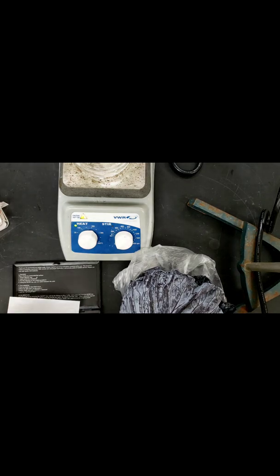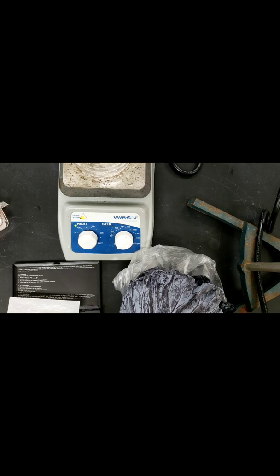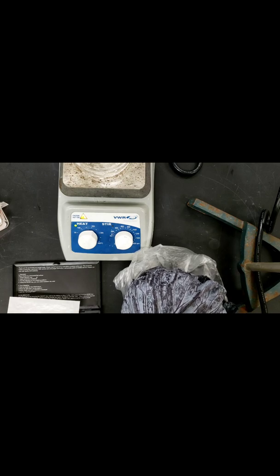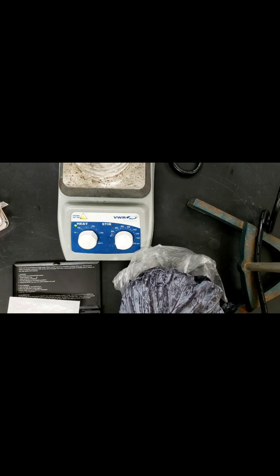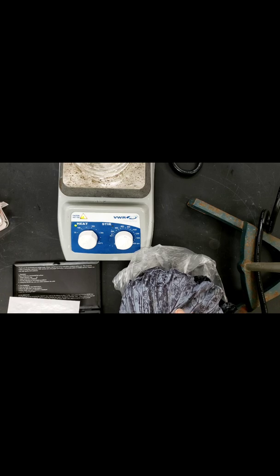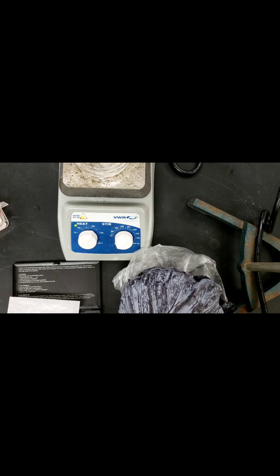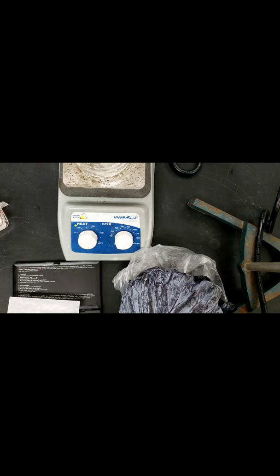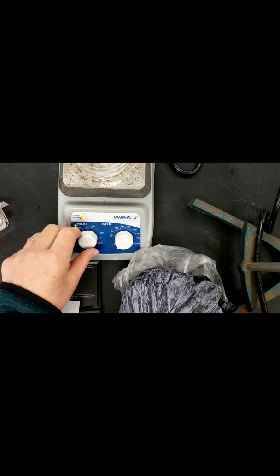Another way that we're going to determine the pH is using a homemade indicator. Red cabbage or purple cabbage contains a pigment that will change color based on the pH. So we're going to make our very own pH indicator.